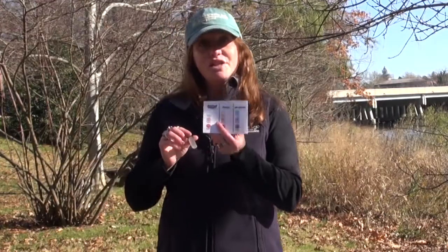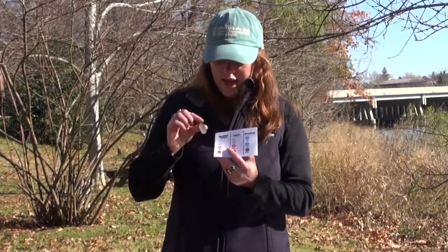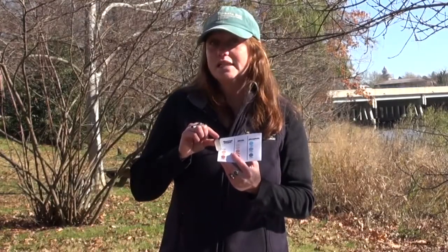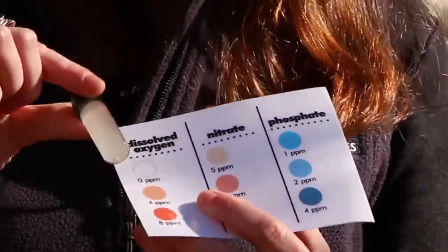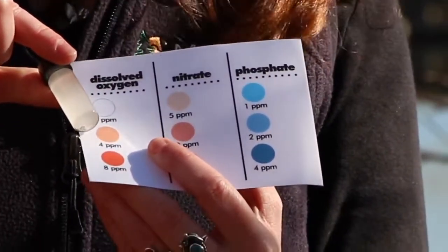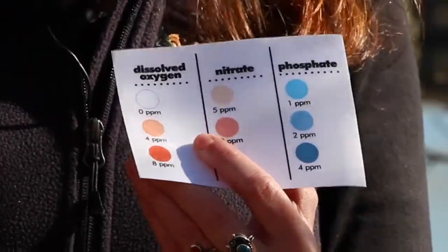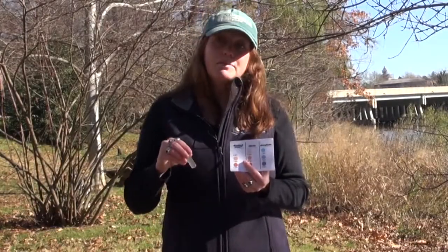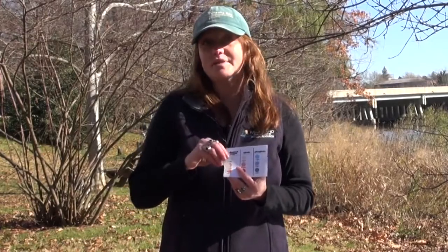I have my cheat card here, which has a range of colors. Just after four minutes you can tell it's not completely clear — there's some murkiness there — and I think in five more minutes we'll see a very pinkish color somewhere in the four to eight ppm range. That's a good sign for this habitat. If you want to be really accurate, you should repeat the test two more times.